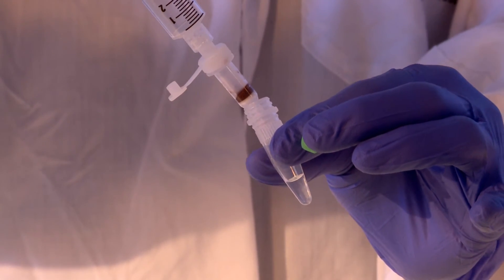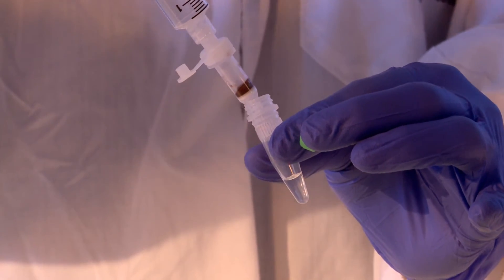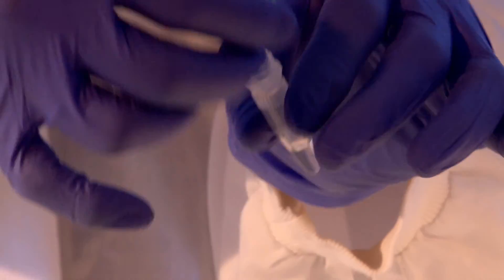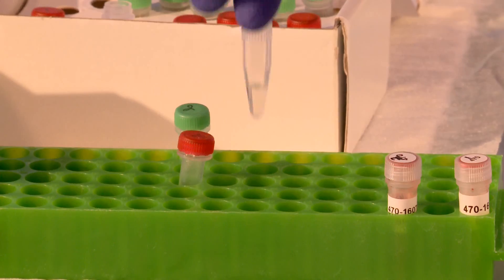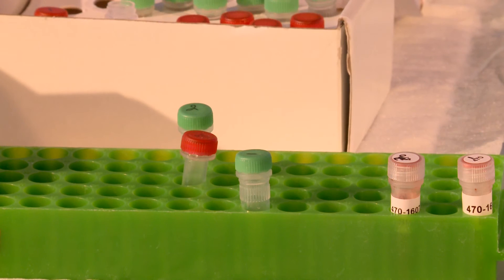Slowly push the plunger into the syringe barrel until a small amount of liquid is expressed from the tip of the column into the PC-run dilution buffer. Cap the vial with the green lid and gently mix to disperse the DNA into the buffer. This diluted DNA sample will be used for the following PC-run molecular reactions.